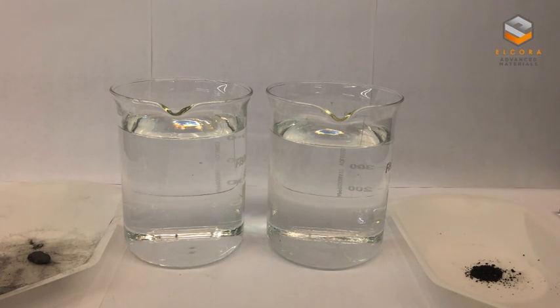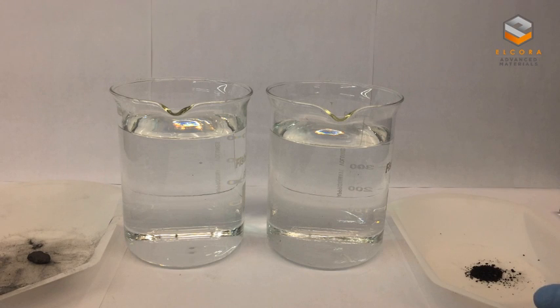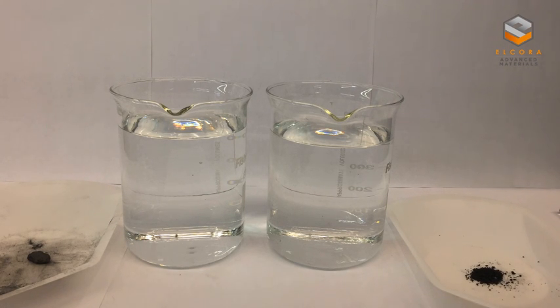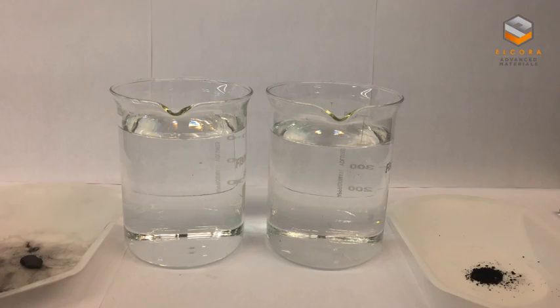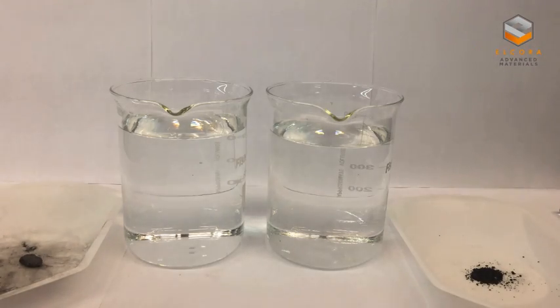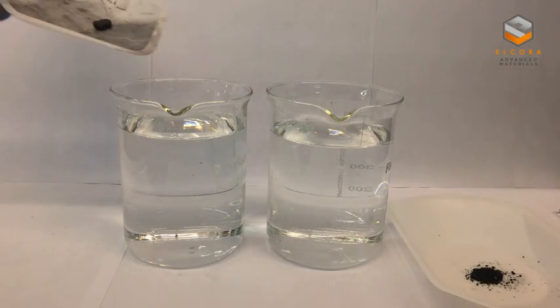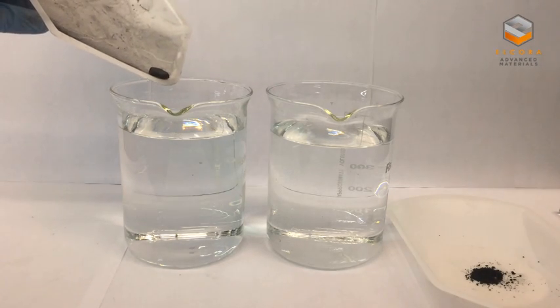Here we have graphite on the left and some graphene on the right. Both of these materials are hydrophobic. We're going to mix them with some water. However, you'll see that they both disperse somewhat differently.